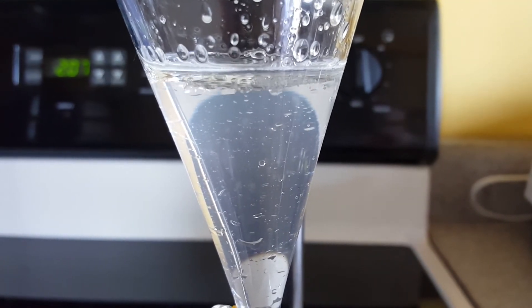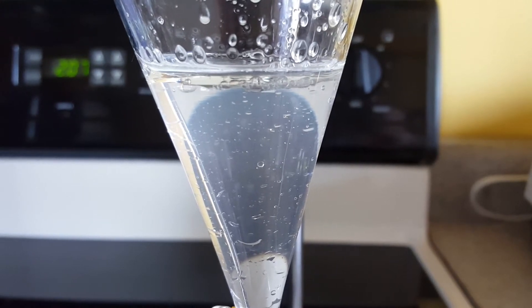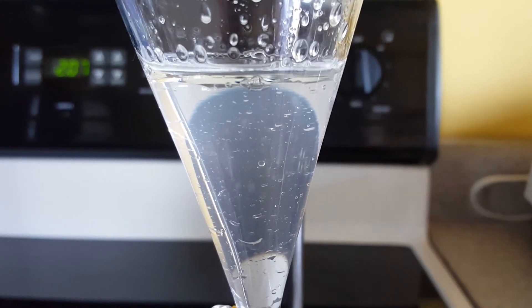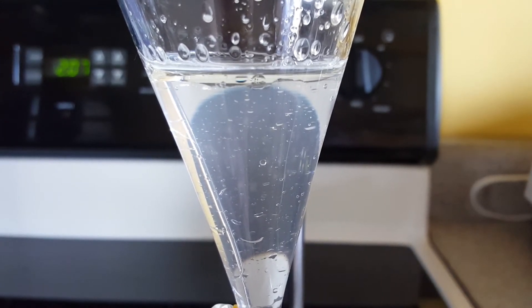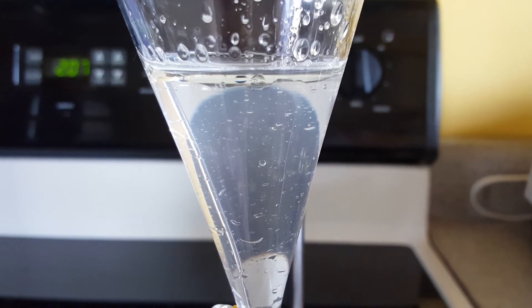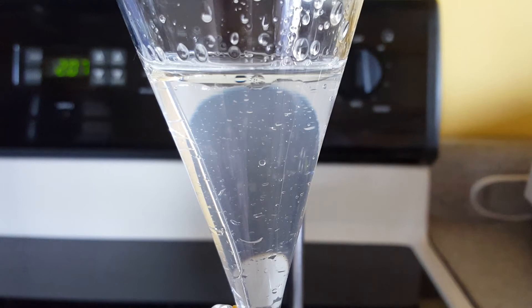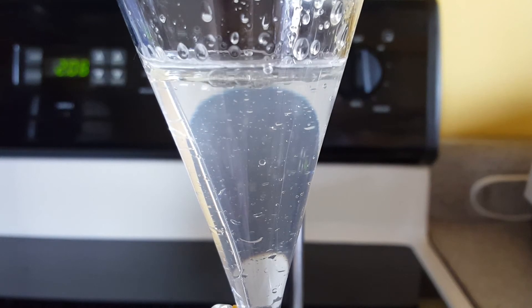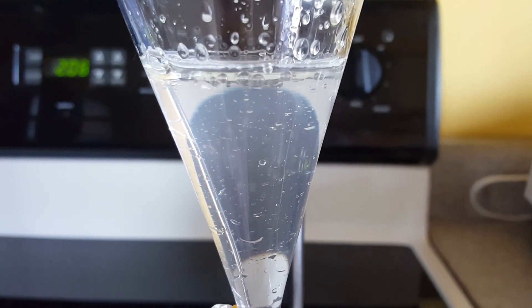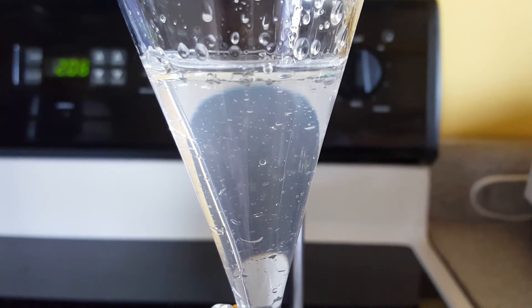It's been about an hour since I started this process and this is the amount of liquid that I've collected so far. You can clearly see the top layer of oils. As the diameter of this funnel increases, if the amount of oil was constant then you would expect that the thickness of this layer would be lessening, but it seems like this layer is staying at about the same thickness, which tells me that there's probably still some oil being collected from the process.